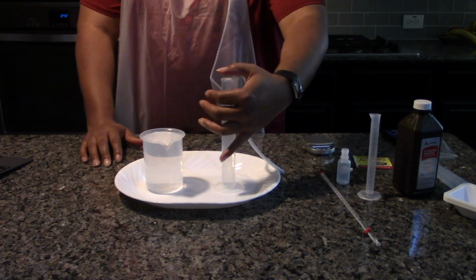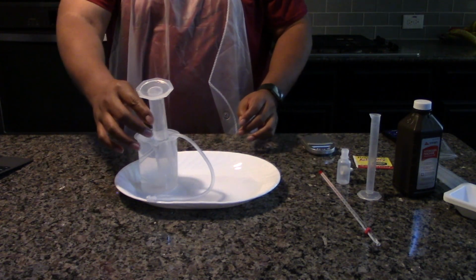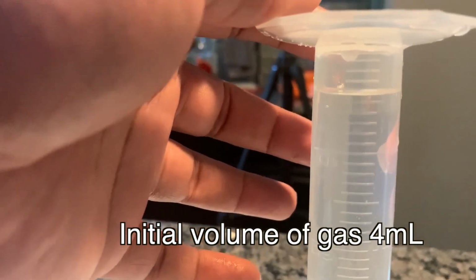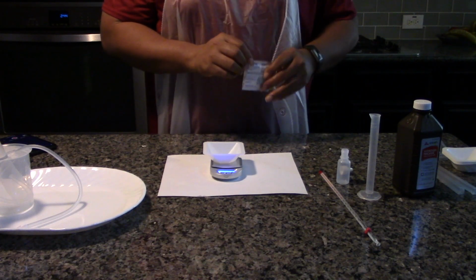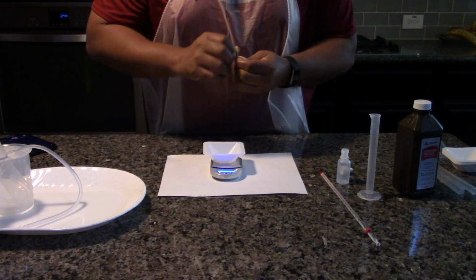Place your thumb over the opening of the 50 milliliter graduated cylinder and invert it into the beaker. Record the initial volume of gas in the graduated cylinder. If no gas is present, the volume will be 0. Turn on the balance, place a weighing boat on the balance, and tare it.